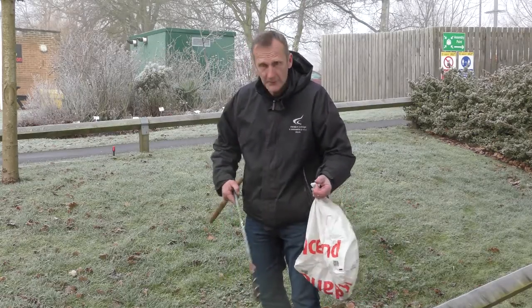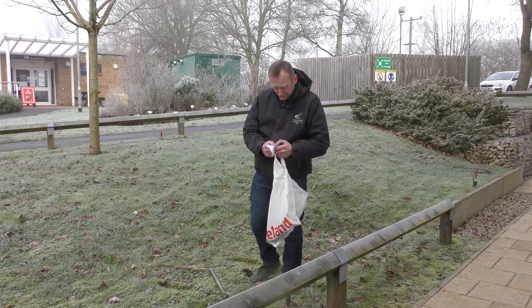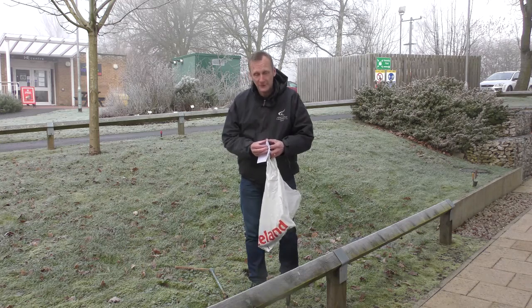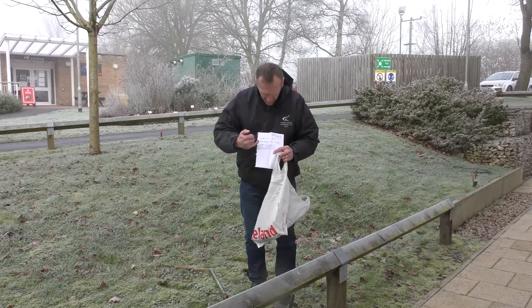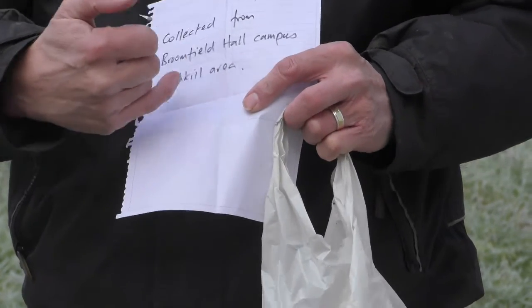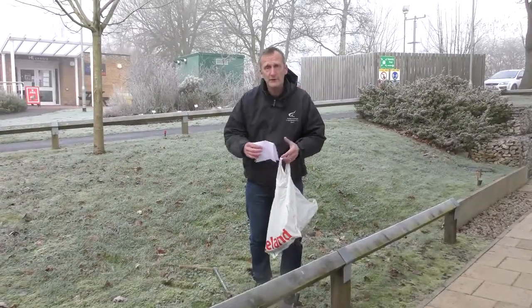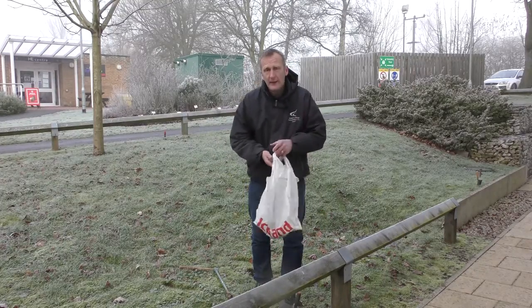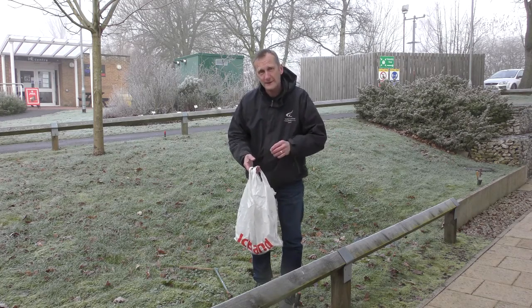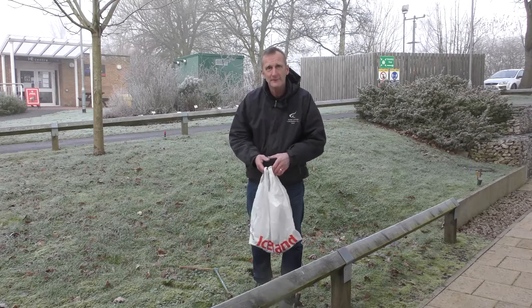The next thing is to put a label on the bag — this is really important, especially if you're doing a lot of surveys because you can easily mix them up. I've already written out a label: seventh of January, collected from Broomfield Hall campus, with the name of the building and the area. You could even include a little plan. Put the label in the bag, then we'll spread it on a tray to dry off before we do the next stage.